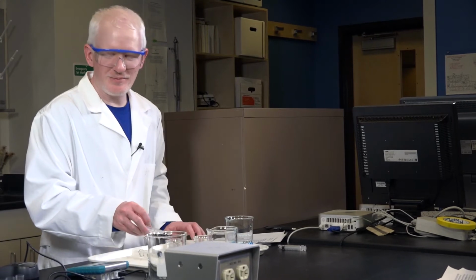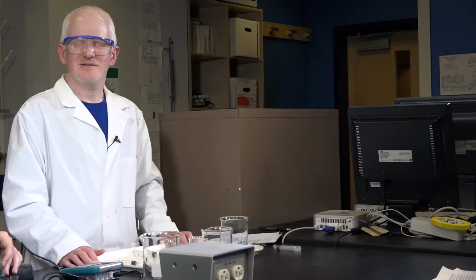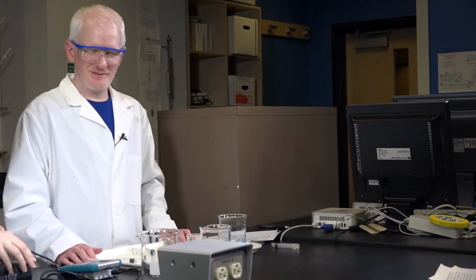So, Addie, which step are you on right now? I am measuring the absorbance of standard 3 right now. Oh, great. Here we go.